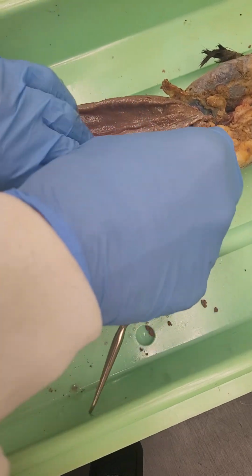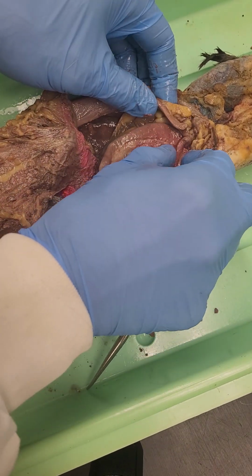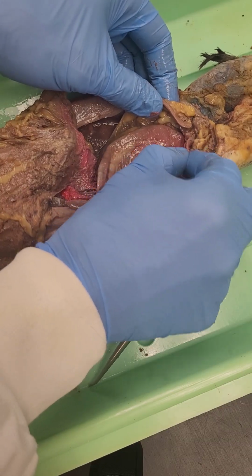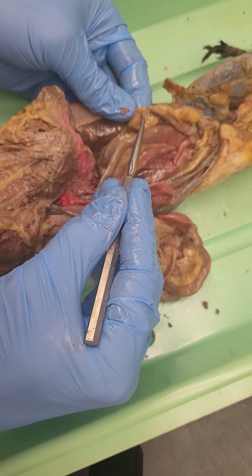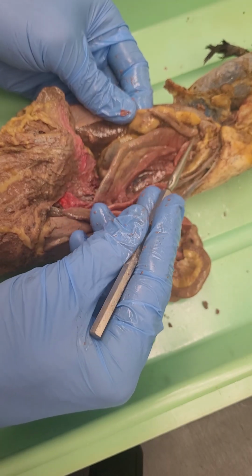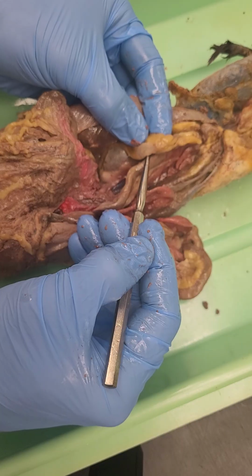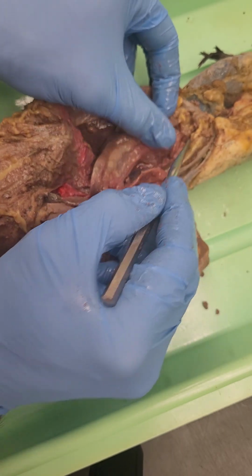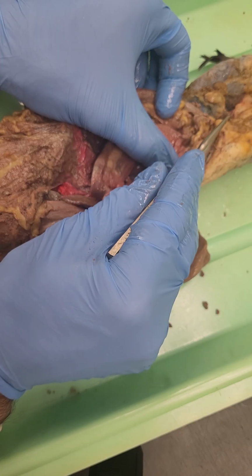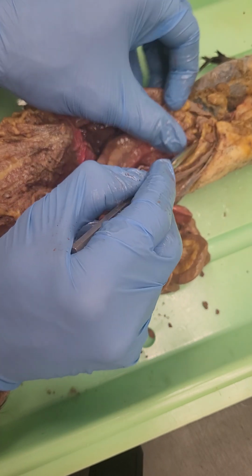Now this is a female mink, and so if I look in here, I'll find the uterine horns, one on the left and one on the right, and if we look closely we can start to see at the end the ovary located at the end of the uterine horns, visible here, this structure. That there. Okay. The uterine horns combine to a uterus, and then we have the vagina, which isn't visible, but will lead to the external orifice.